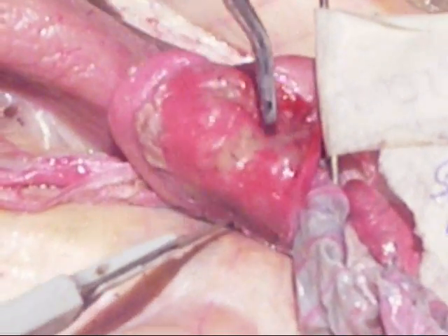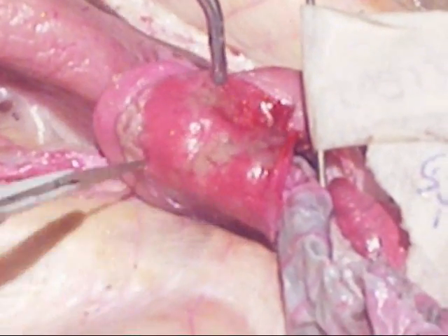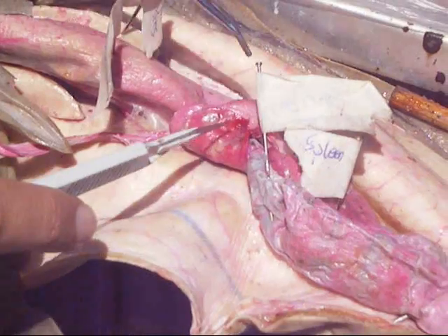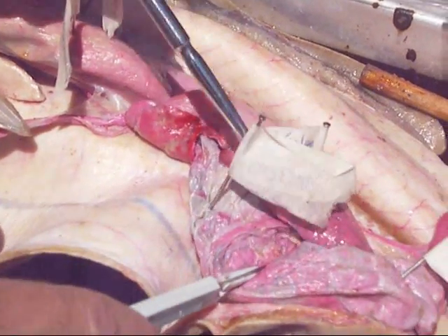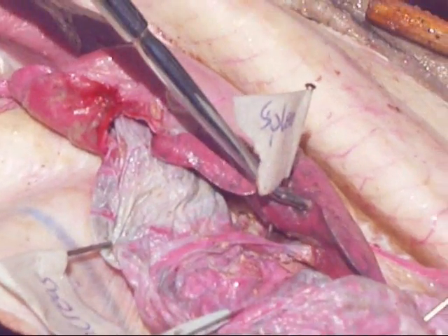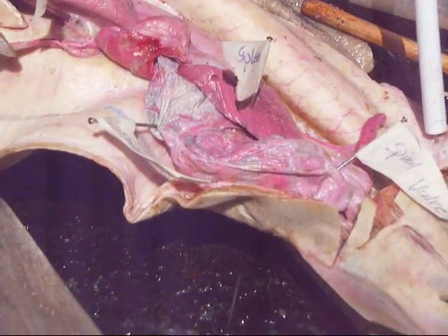That paint looked so weird at first, until I realized... but this is kind of pinkish, kind of brownish, normally. I can show you my other class's pancreas if you want. And then the spleen is like this triangle thing. All the sharks have that. Most of the sharks' spleens are like dark brownish gray, but this one's bright red because I don't want paint in the thing.